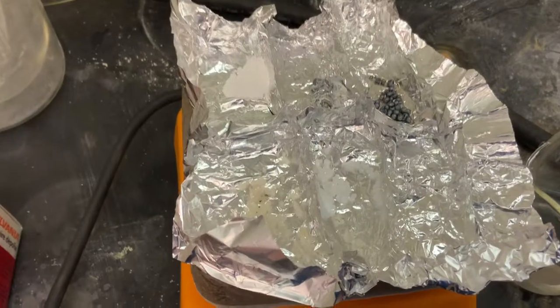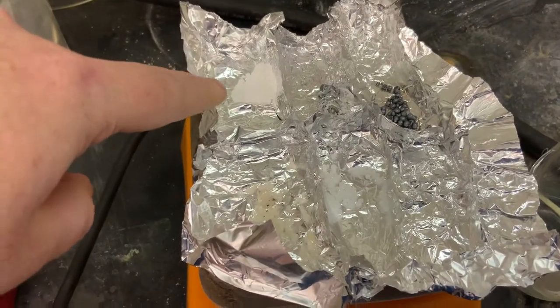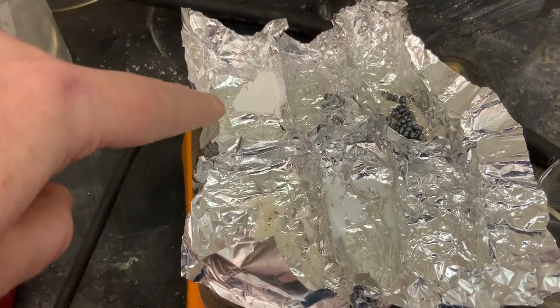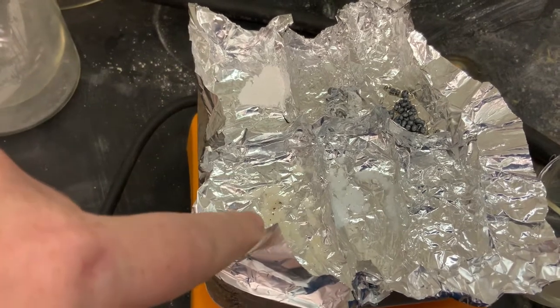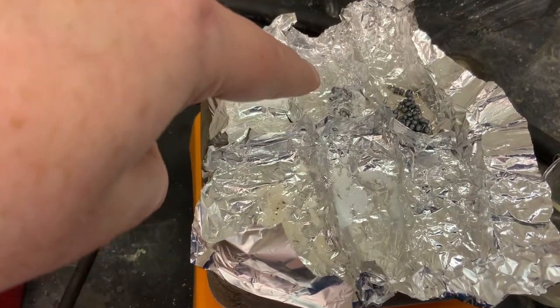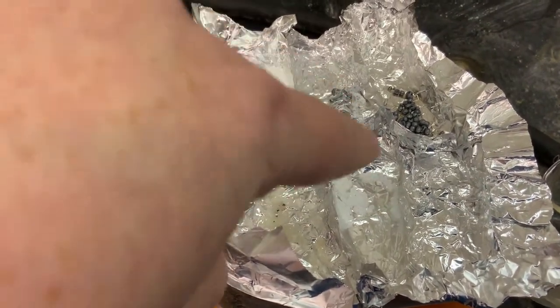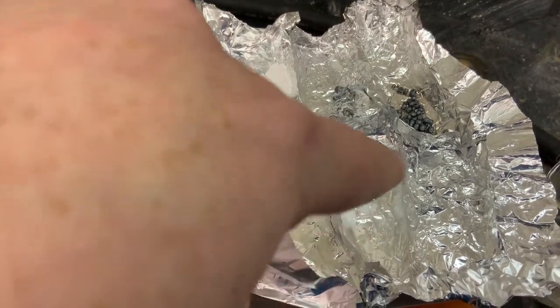For our final test we have our melting point set up. This one is unknown one. Unknown two. Unknown three. Unknown four. And unknown five.